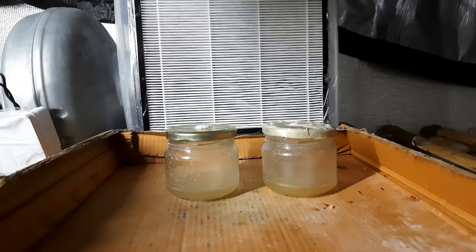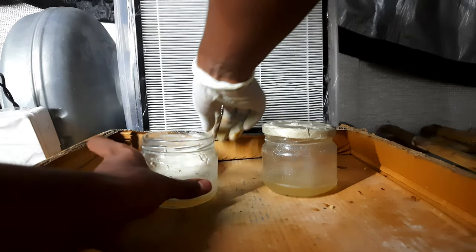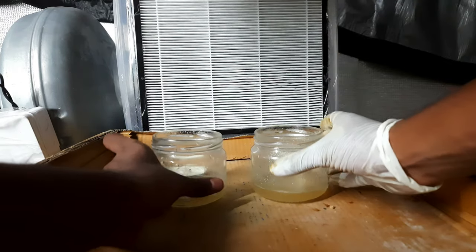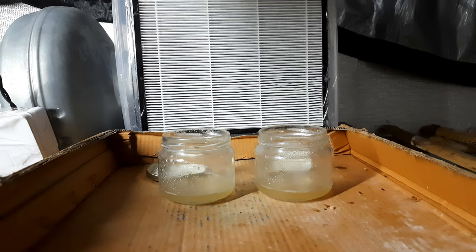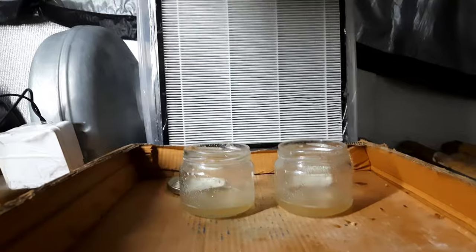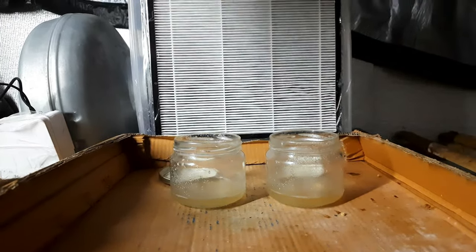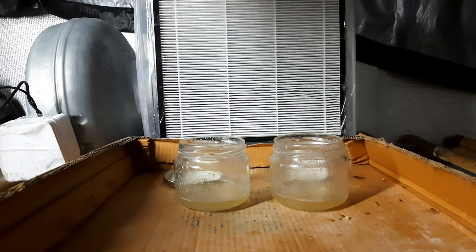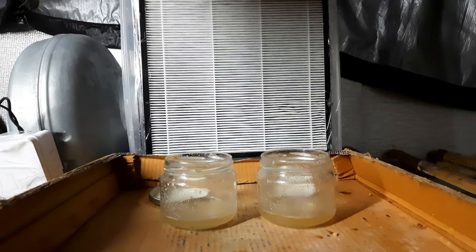I'm going to be packing them up. This is something called a laminar flow — a mesh-like structure you can see over there. For this fun project it's not strictly necessary, but for professional uses it is. For example, mushrooms sold in markets are grown by breeders who grow mycelium on agar, then use that mycelium to inoculate other grains. We have a small business, and I'll soon be making a video on how to grow mushrooms at home.